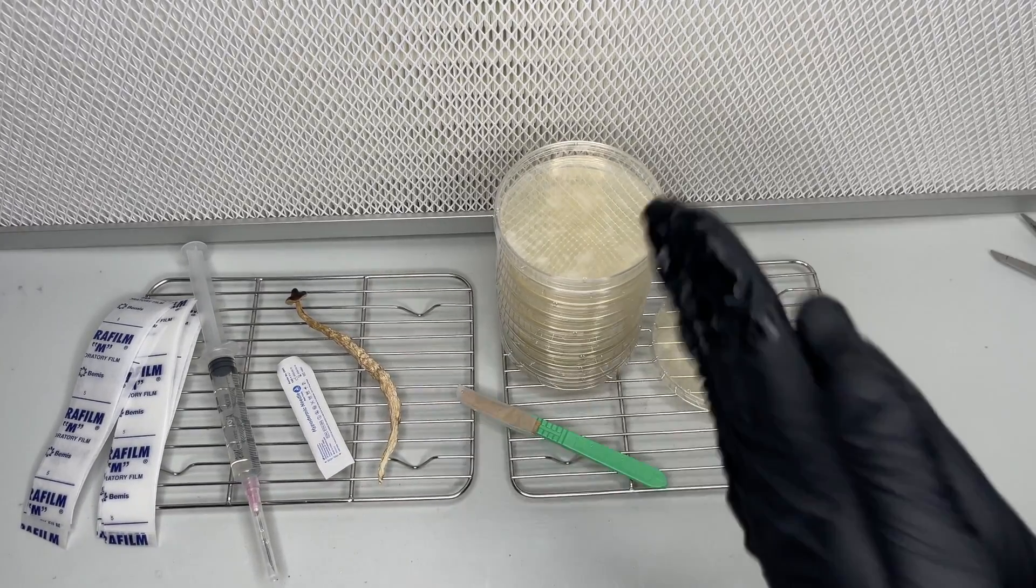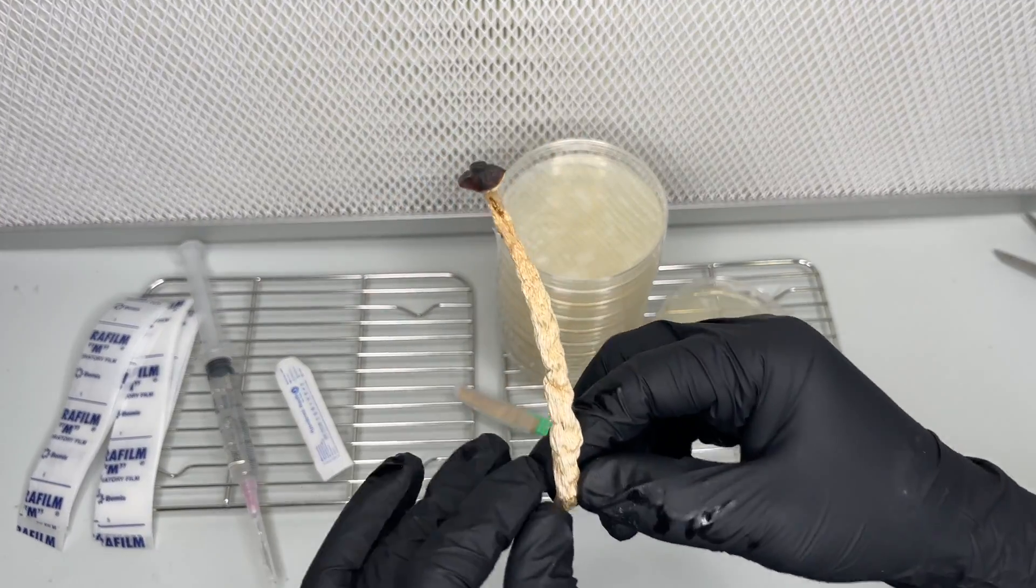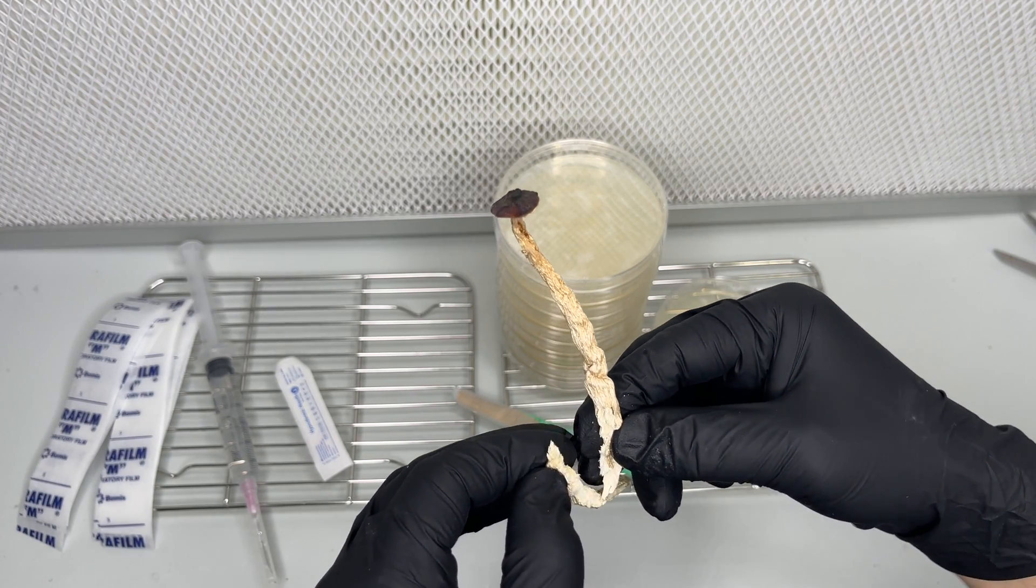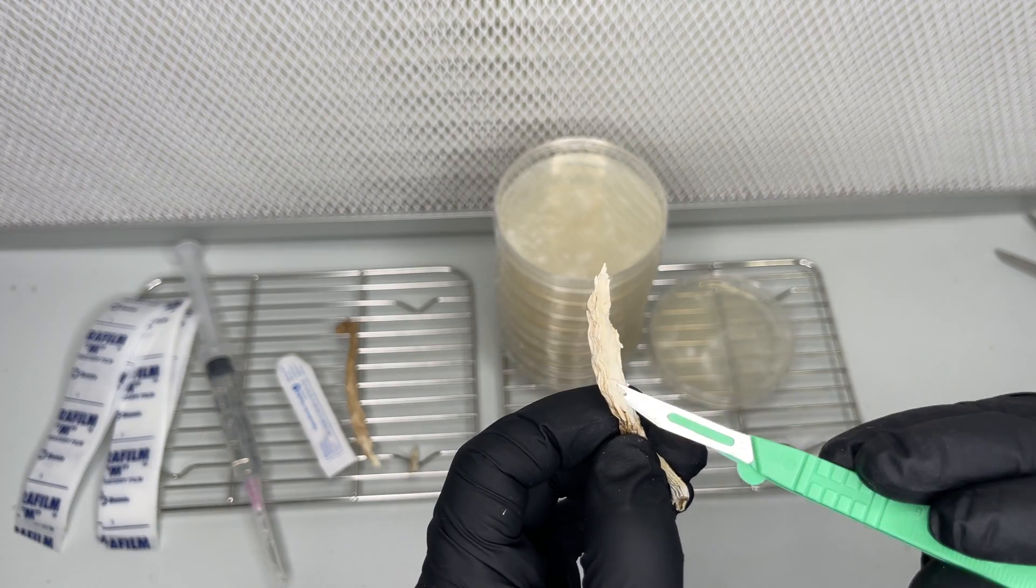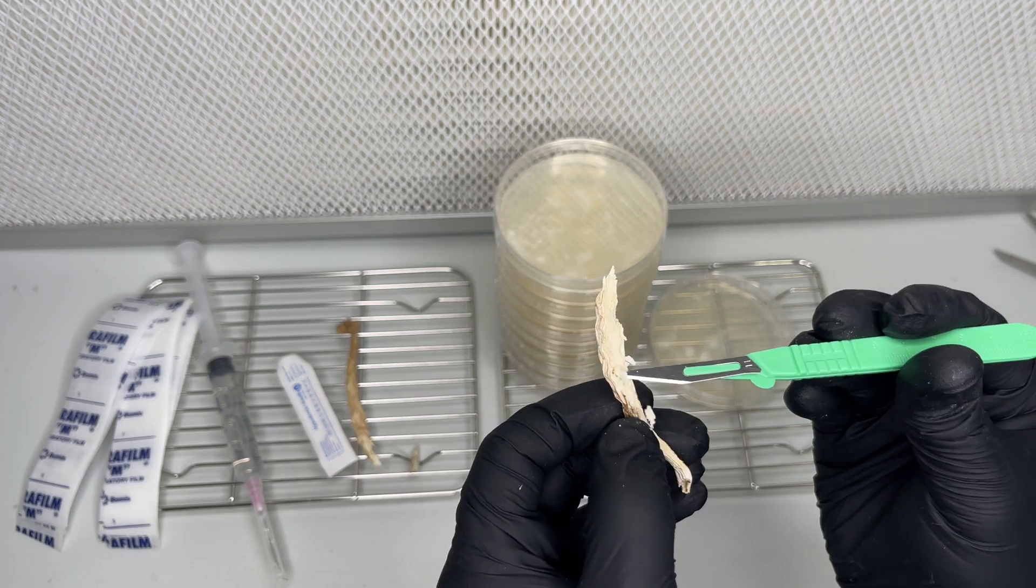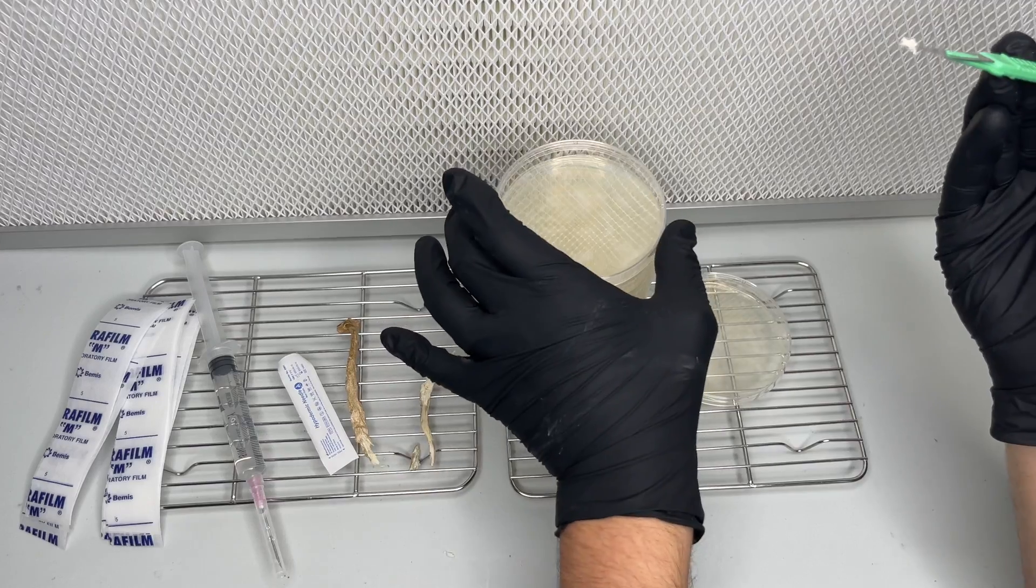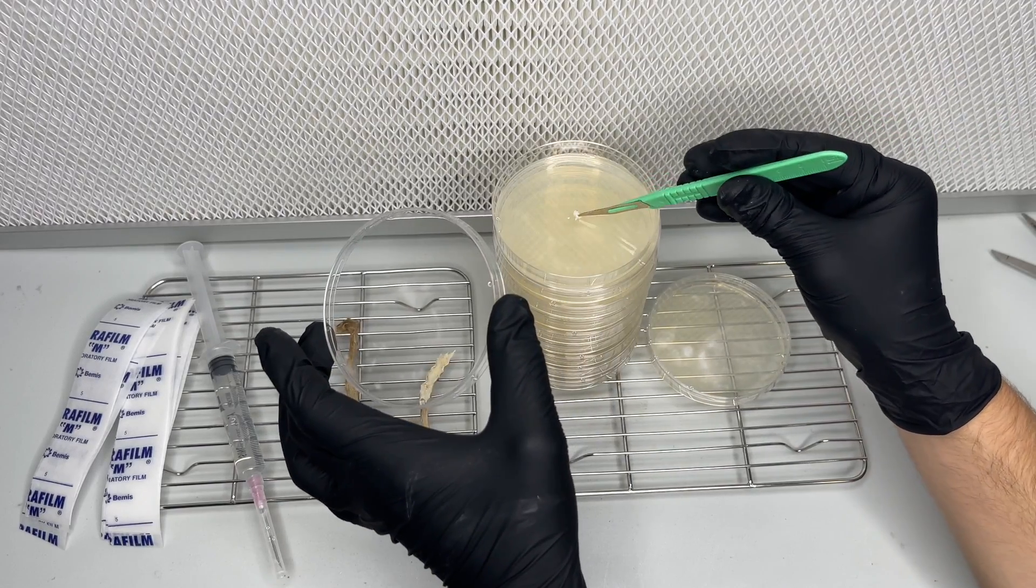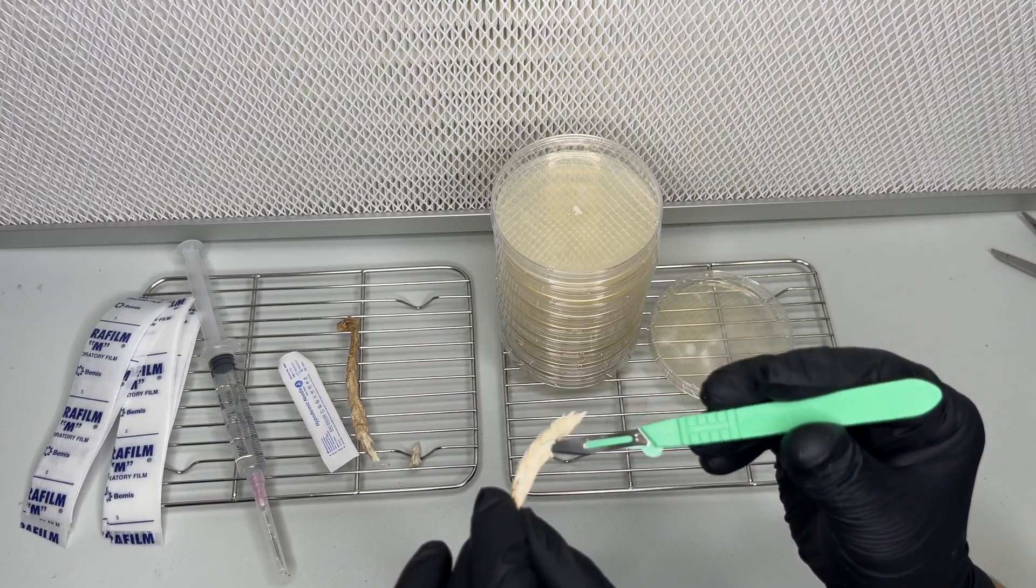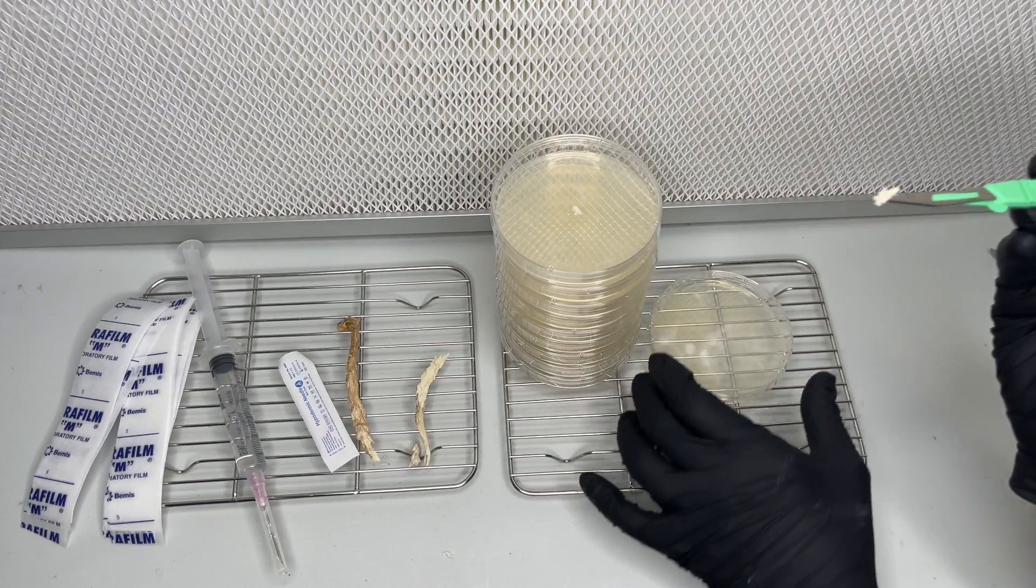Once the mushrooms were dried I set up my workspace again to take transfers.